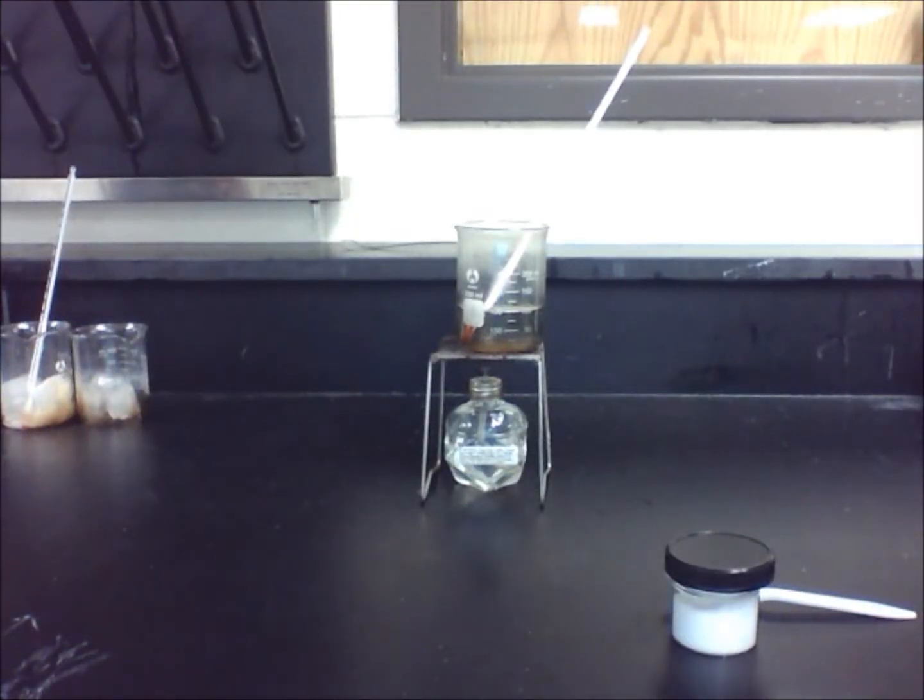In lab 18.2, we investigate further how adding solute to a solvent can change the properties of each substance. This time, we will see how boiling hot water will be affected by the addition of salt.